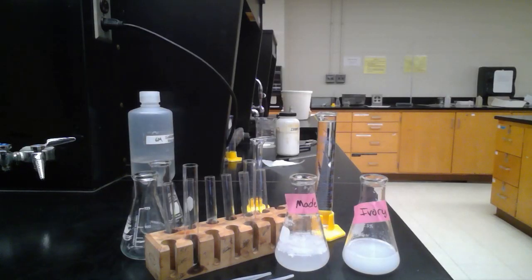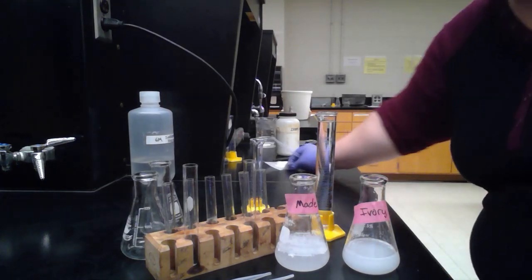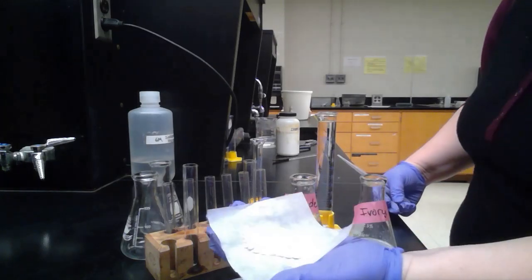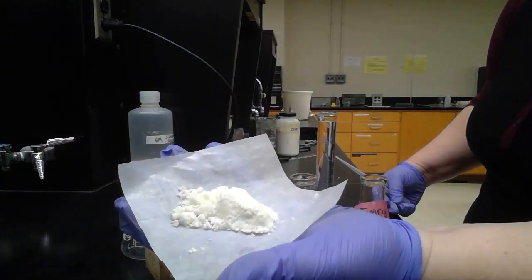We've dried out the soap. We took the mass of it, which is 9.92 grams of our made soap, and this is what most of it looks like at the end, the soap that we made.